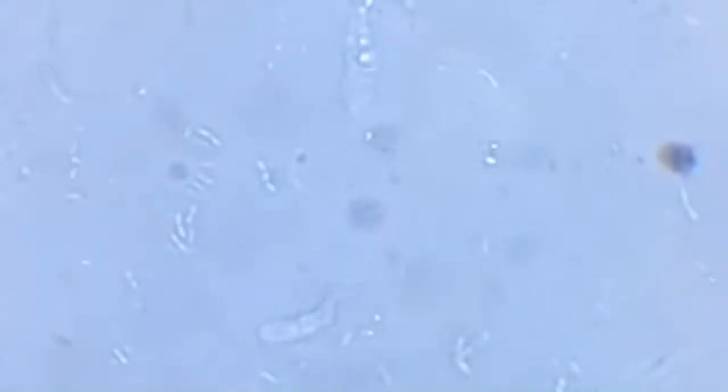You also see refractive images of various bacteria. A larger amoeba is coming from the top. It's really huge. Maybe he gives us a better picture. This is the sharpest that I can get.